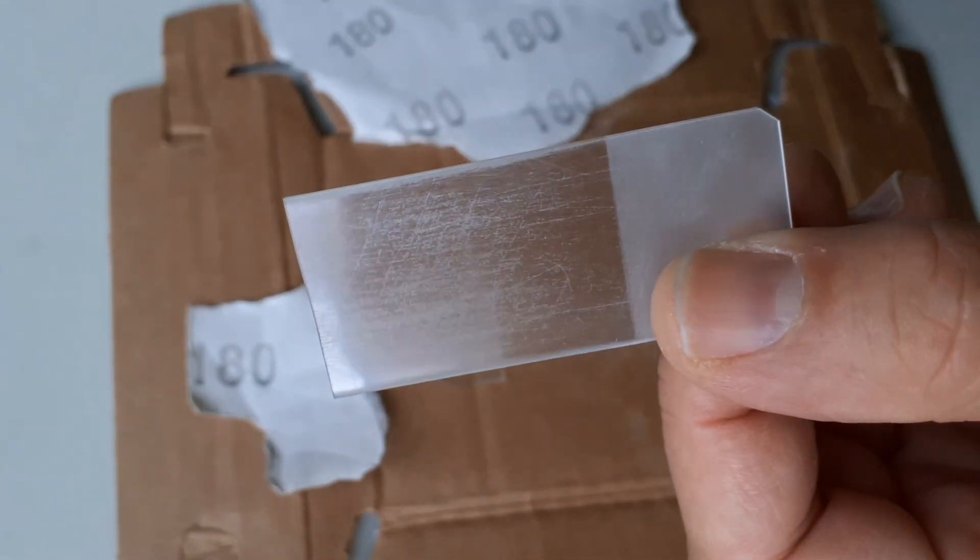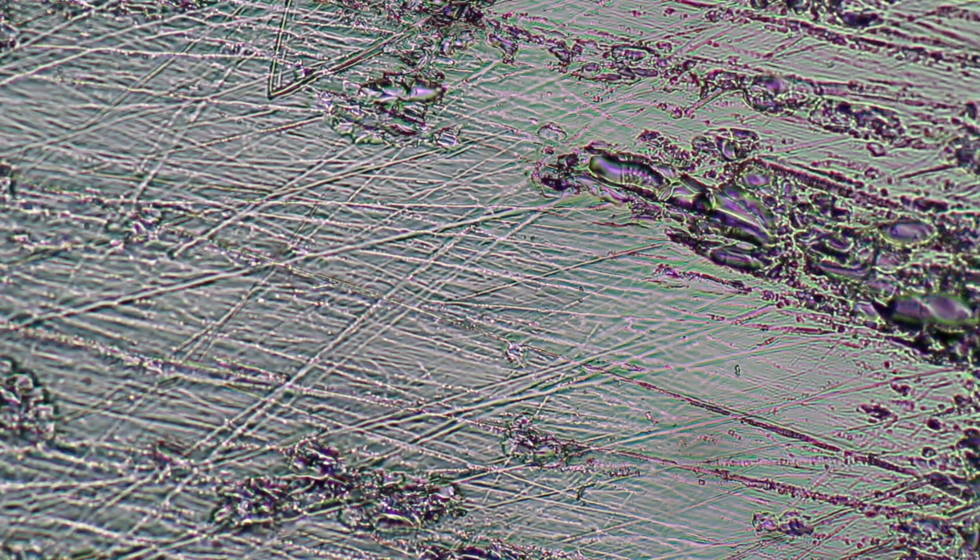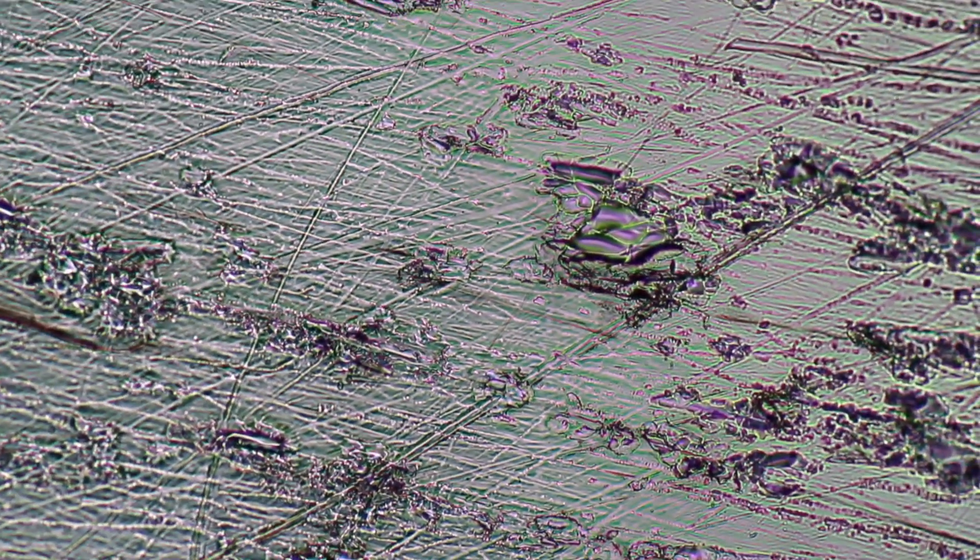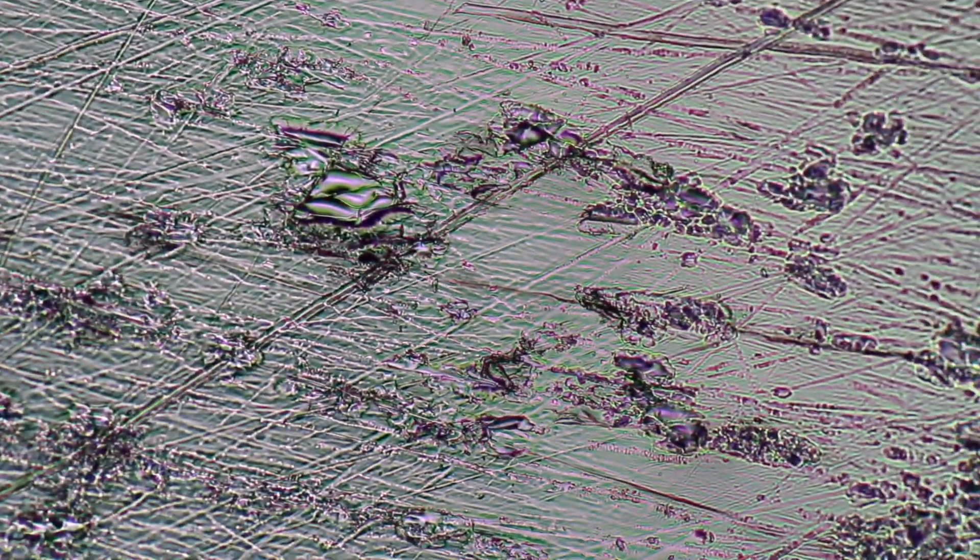Unfortunately the slide broke. This does not matter and here this is how the scratches, how the surface of the slide looks like under the microscope. So I'm quite sure that the nail polish will stick quite well.